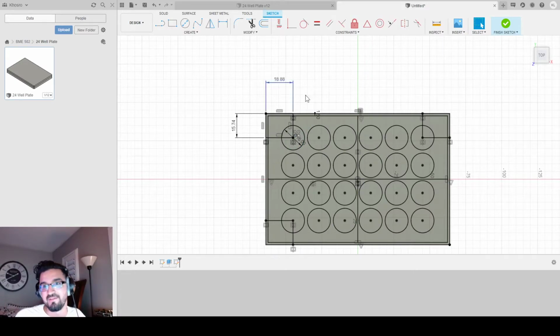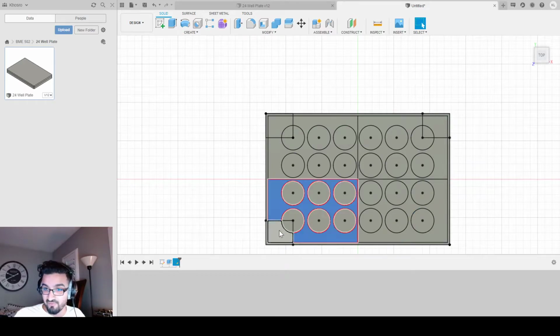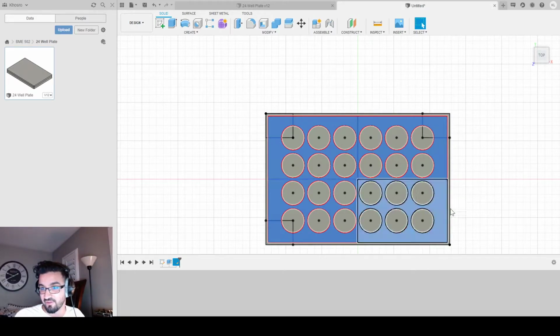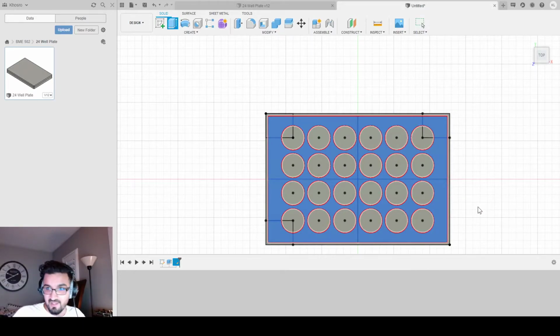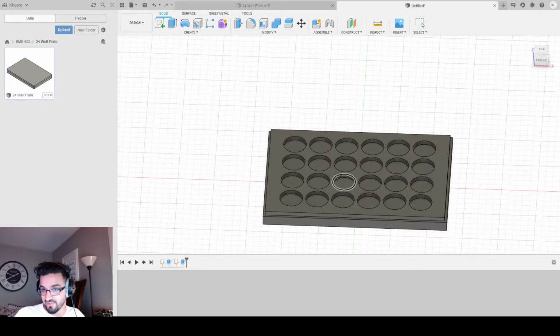We're gonna do one more cooler thing. So now I have 24 wells completely the same distance apart from each other, completely symmetric, completely everything across from each other, right? And now I can finish my sketch. So in the previous video, I extruded the whole square first and extruded down. In this more advanced video, I'm literally just gonna select the outer shape, everything except my circle, and extrude this by 3 millimeters up, right? And what that's gonna do is give me my holes here.